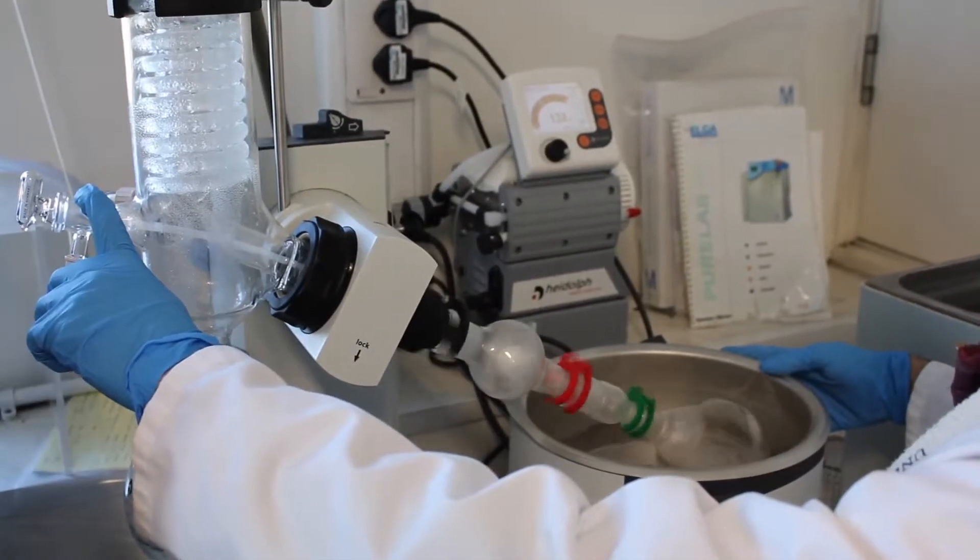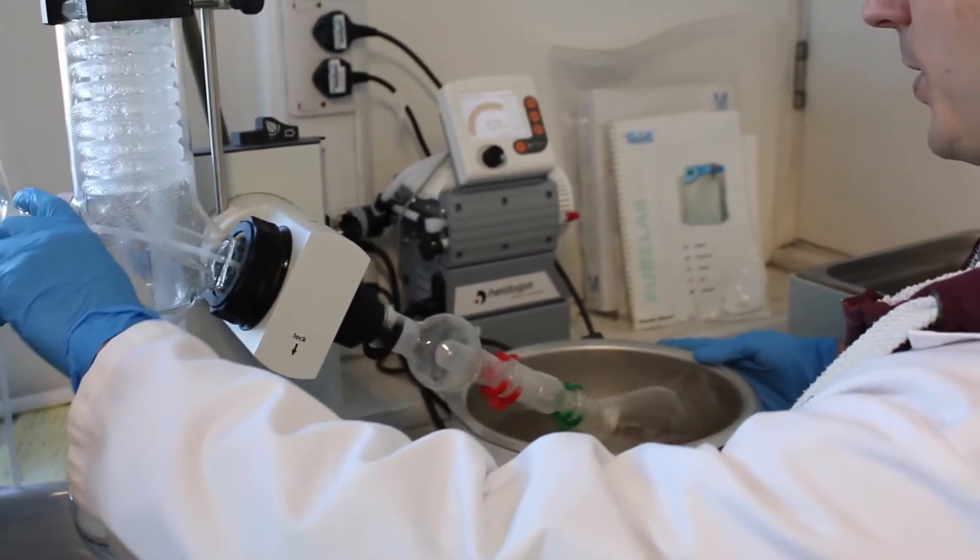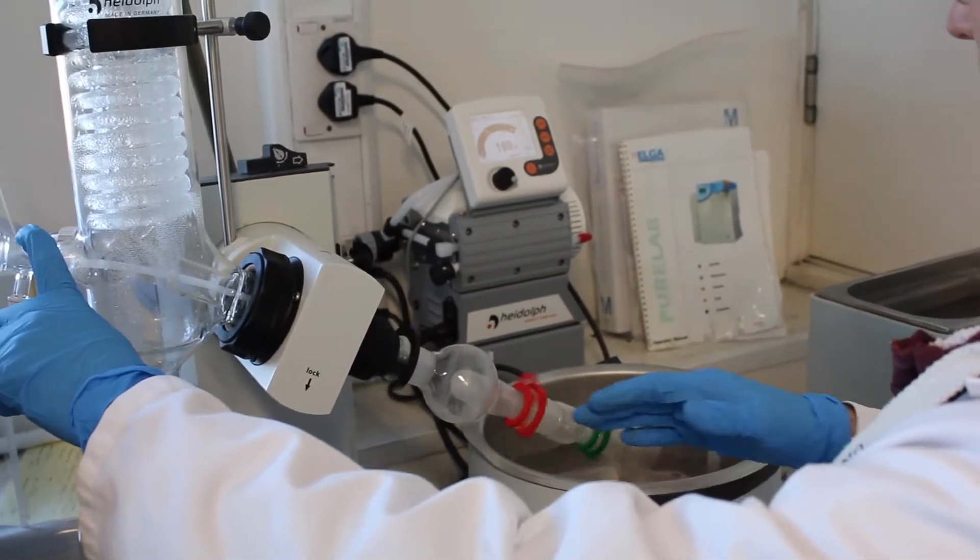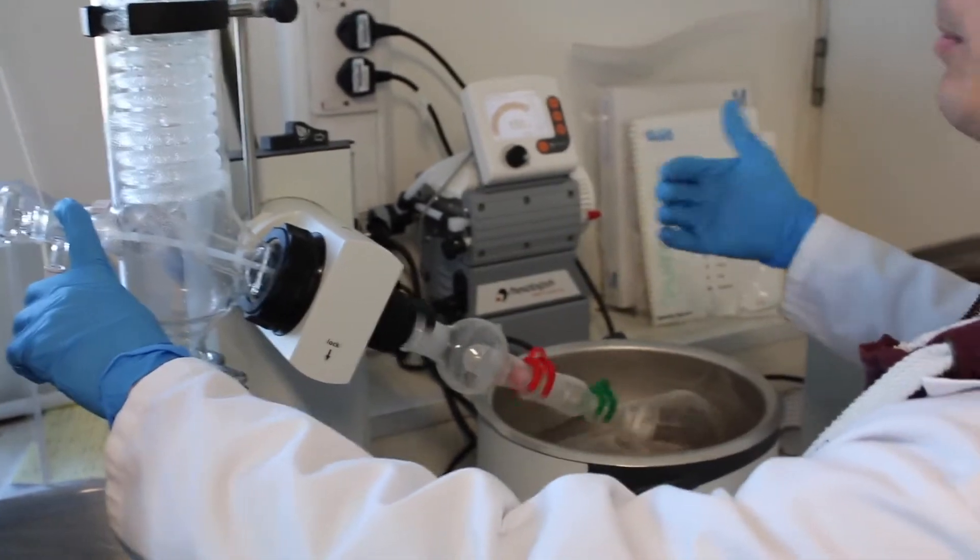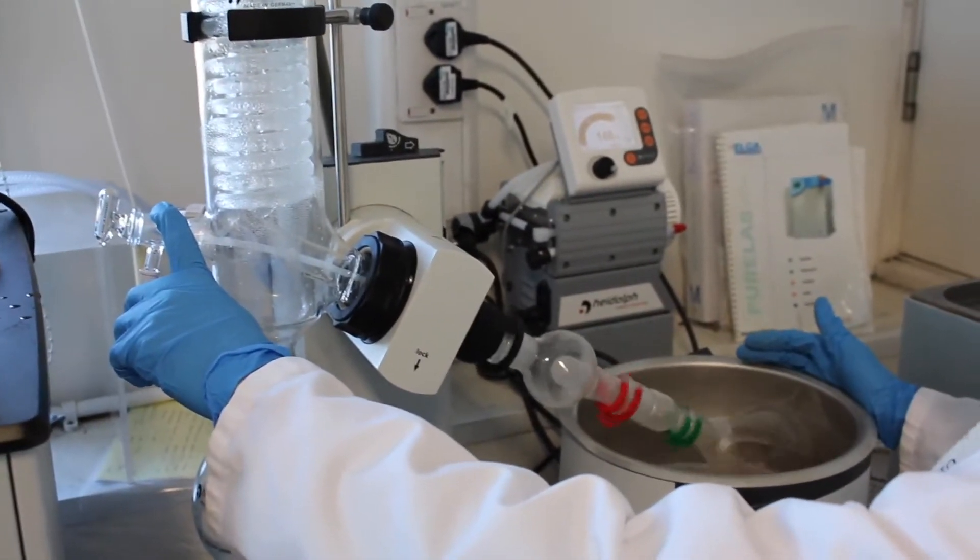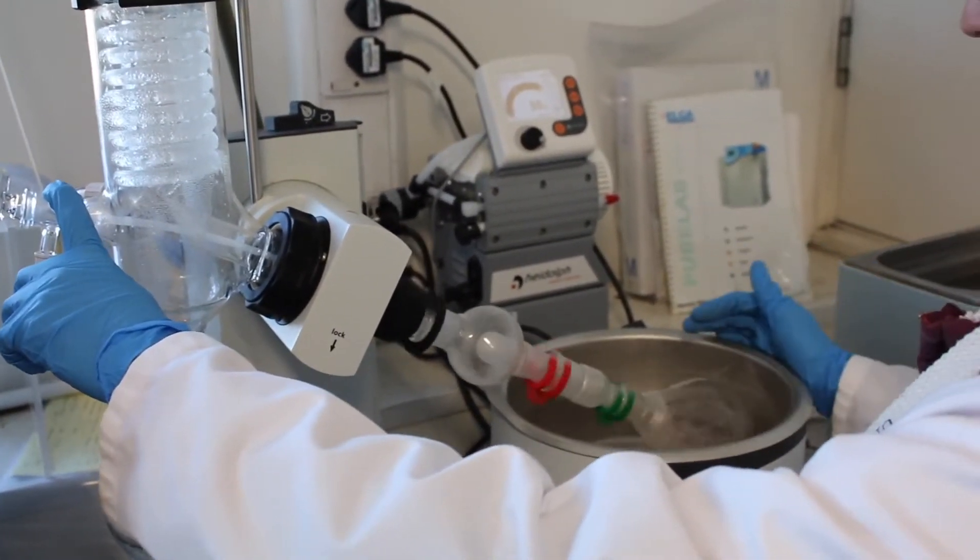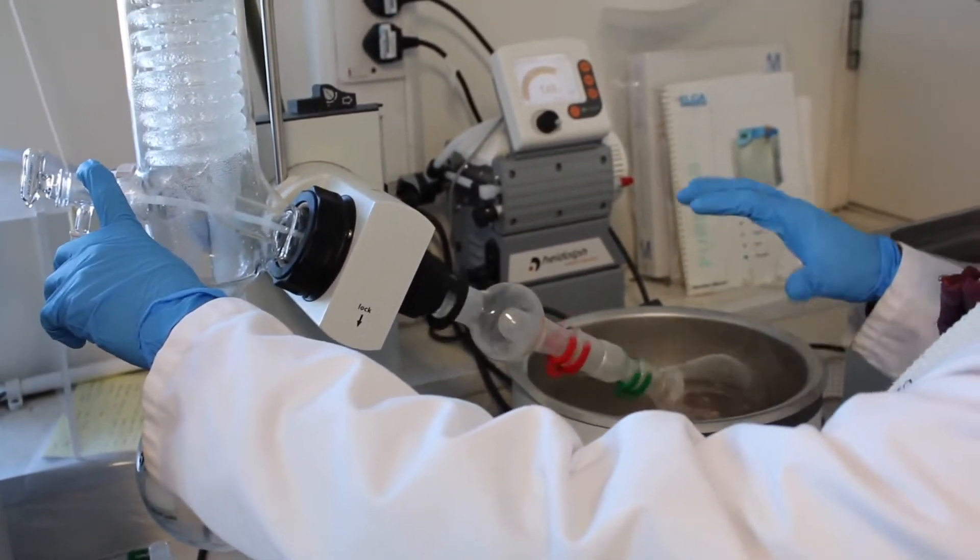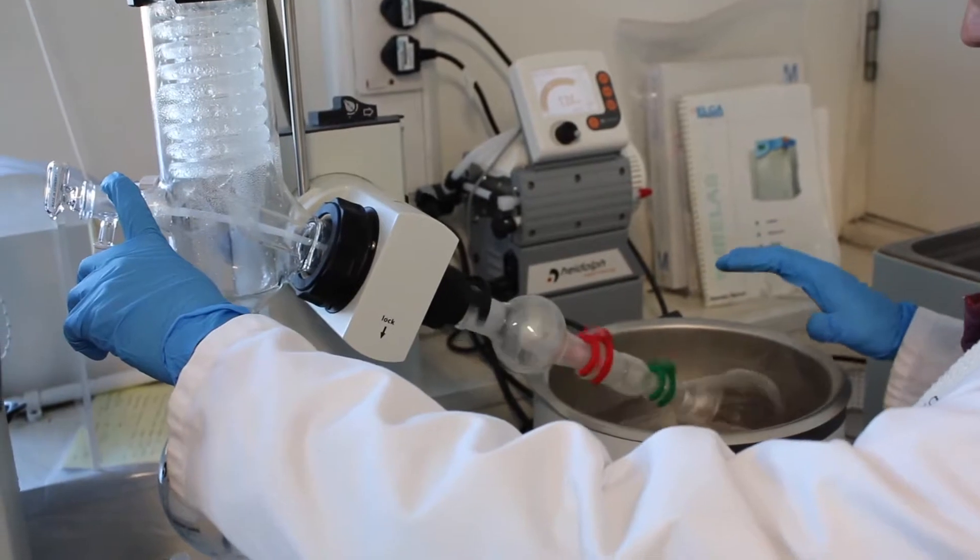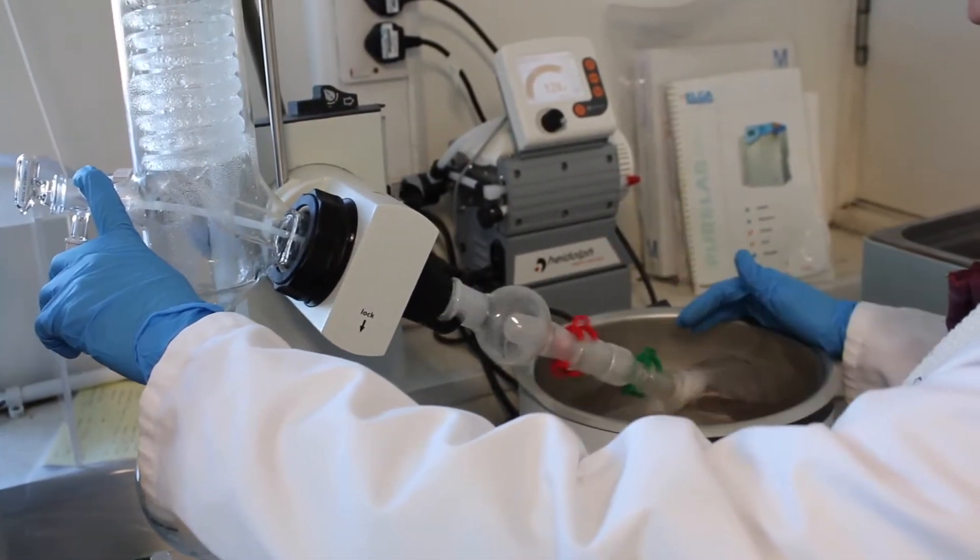It's very good practice before starting to use this instrument to give a nice wash to the splash guard in order to avoid contamination of your compound. You need to patiently stay here and reduce the pressure manually for a little bit until the system goes to equilibrium.